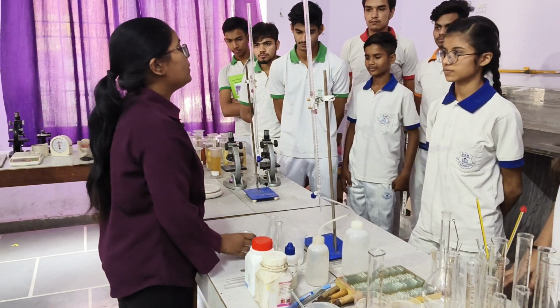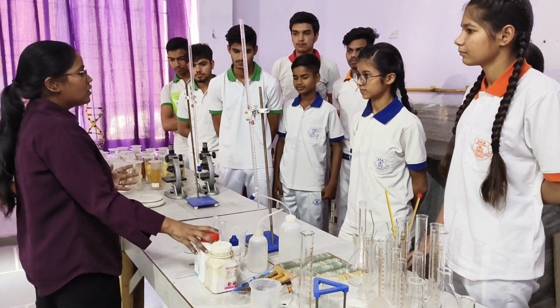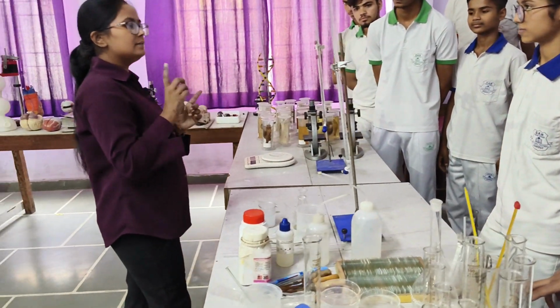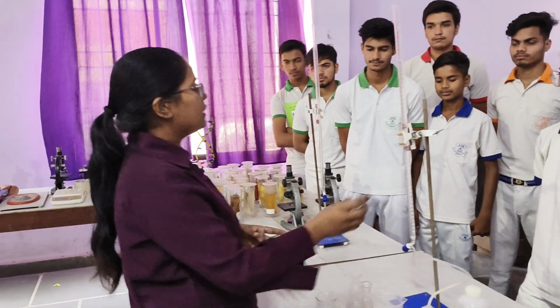Today we are going to perform a titration experiment to determine the strength of oxalic acid against NaOH. Now here, oxalic acid is an acid and NaOH is the base. So for this, what do we require?